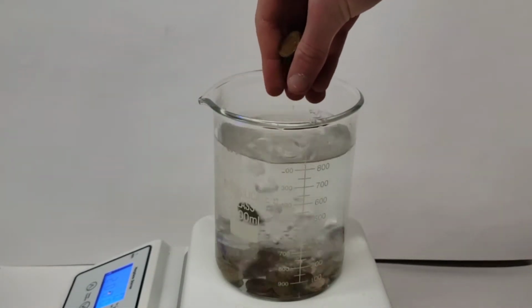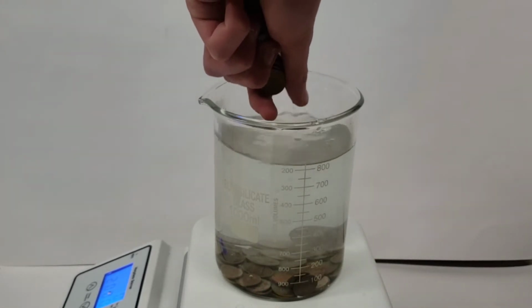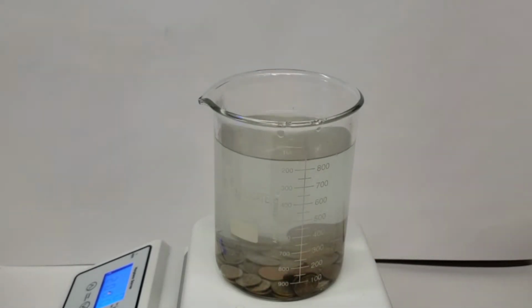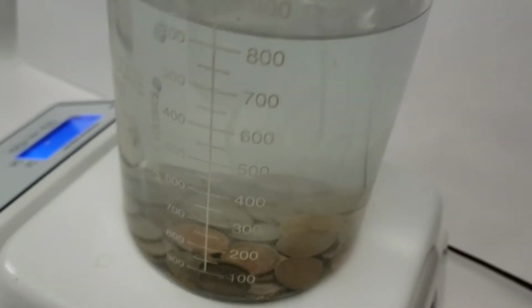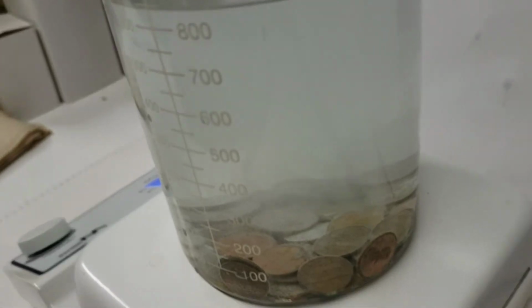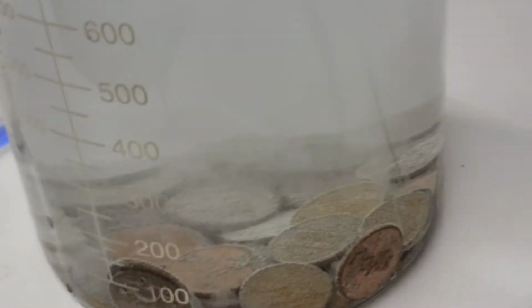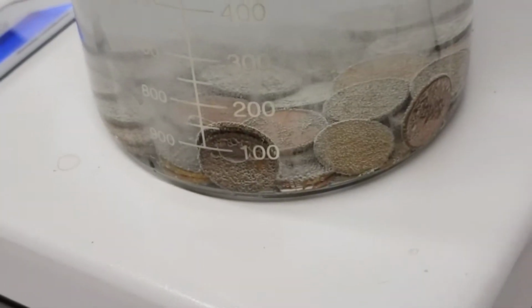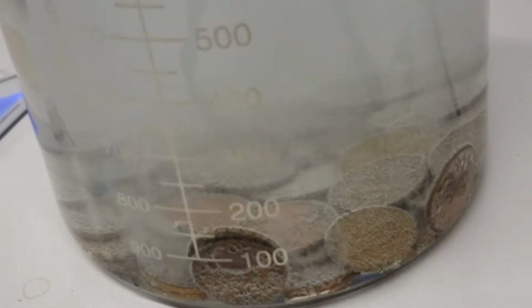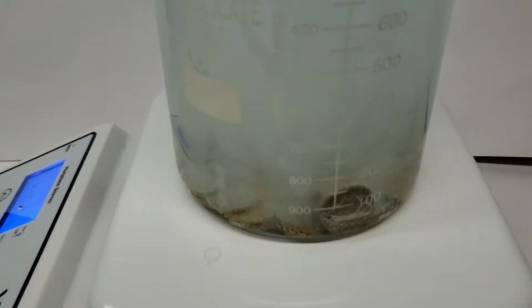Now, once the solution is close to boiling temperature, you can just drop the pennies in like this. And upon dropping them in the peroxide acetate solution, you'll notice that pretty much immediately there's some bubbling, and the liquid turns a pale greenish color. This is the copper dissolving off the surfaces of all the pennies, which of course starts the second the pennies hit the solution. And you can see already it's got a pretty strong effect. And in less than a minute, the solution's already pretty opaque.